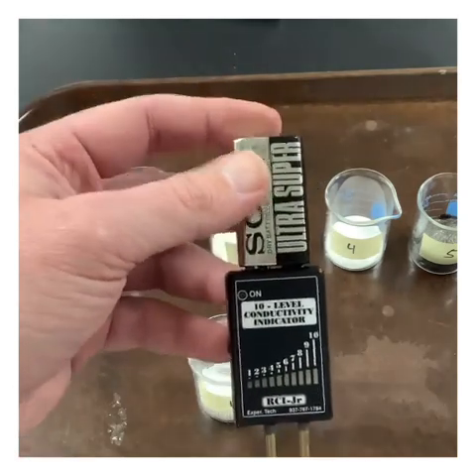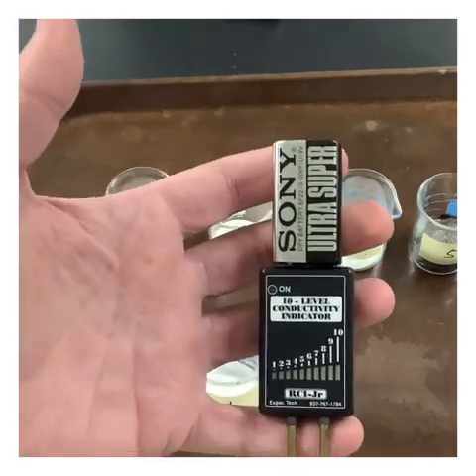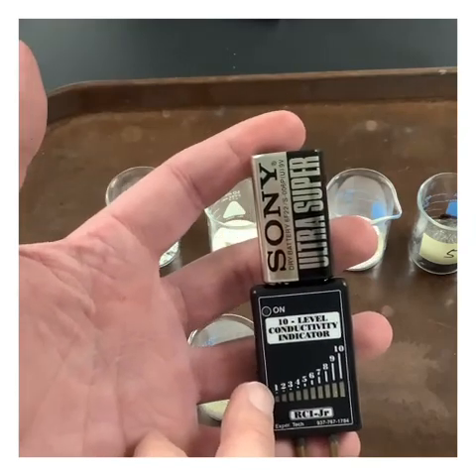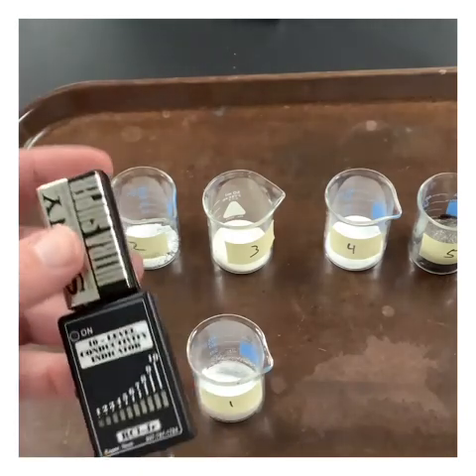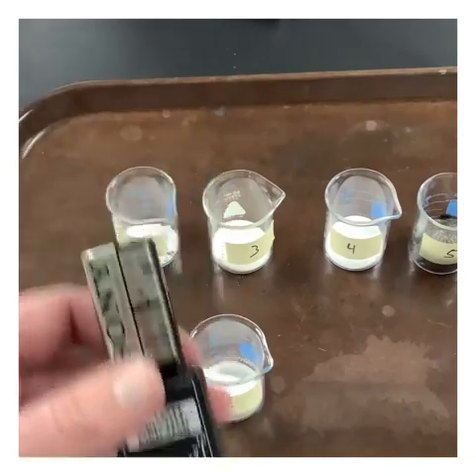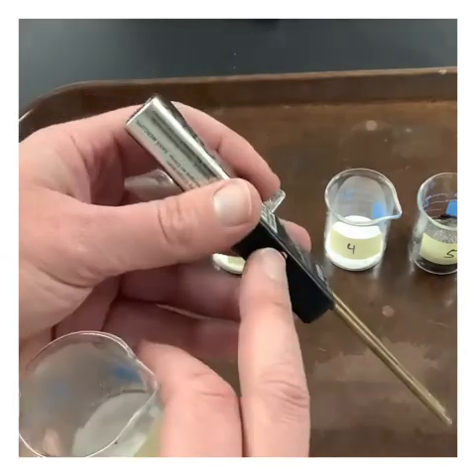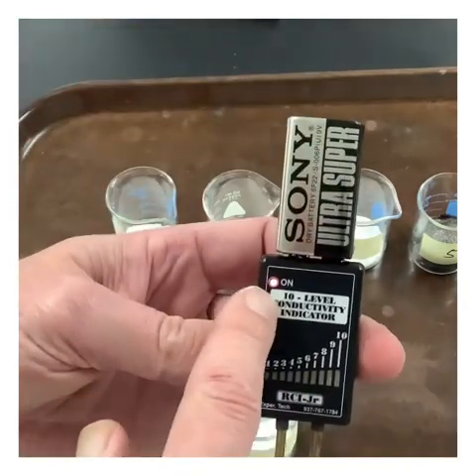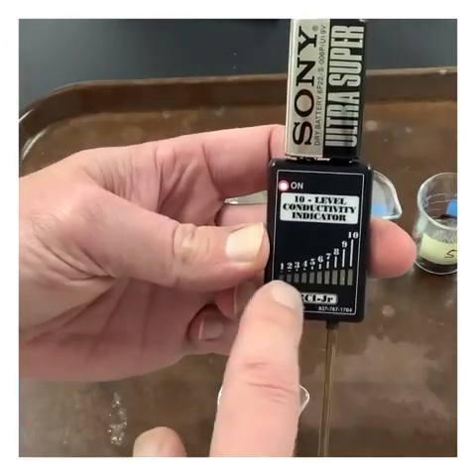However, what I've found just through experience is that items that are not supposed to conduct oftentimes will give a small, tiny little bit of conductivity, mostly just because our glassware is not clean and we have residues left behind. Plus, there could be little bits of tap water and things like that. Tap water conducts electricity really, really well. So there's a little button on the side here, and when you push this button, we get a little red light indicating that the unit is on.